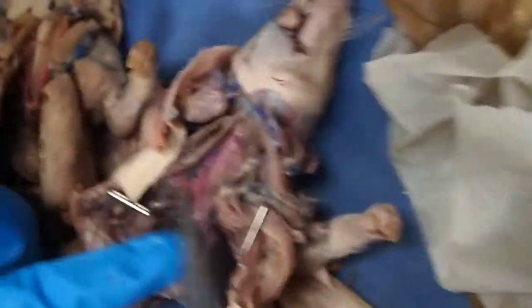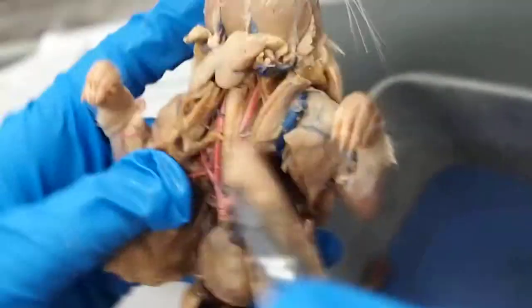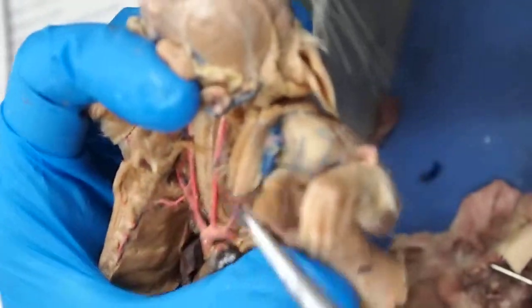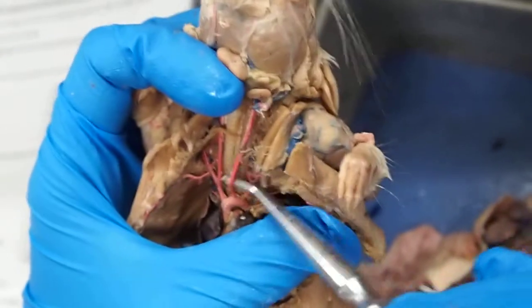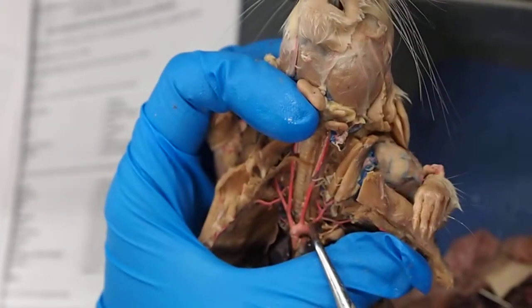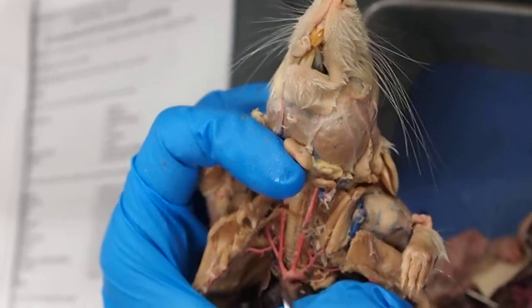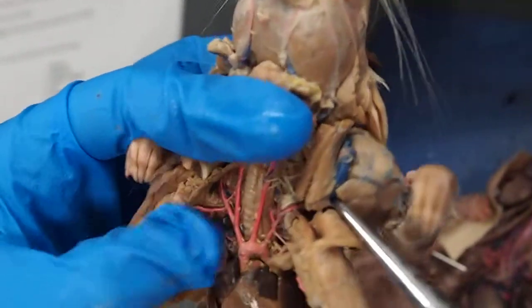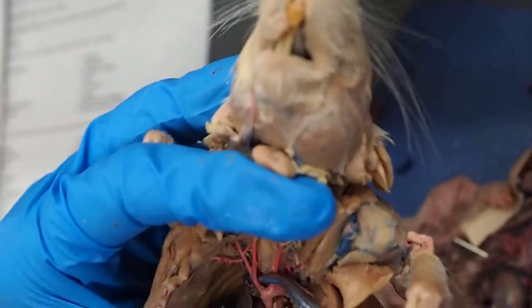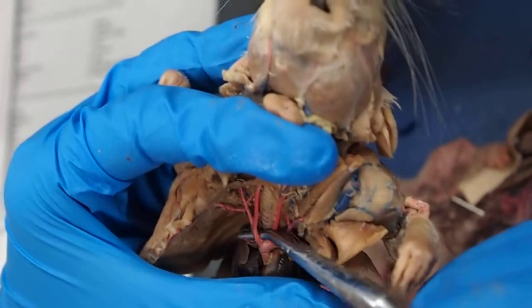Now for the upper half, I'm going to use the demo rat for this. We're basically going to start at the aortic arch, right here. And then this separates, it's different on both sides. The left side is a little easier, so this is the left common carotid artery. Make sure you put the full name on the test if it appears. This is the left subclavian artery, the second one off the arch. On the right side, it's a little bit different. We actually have the brachiocephalic trunk. It is this tiny little section right here, and that's it.